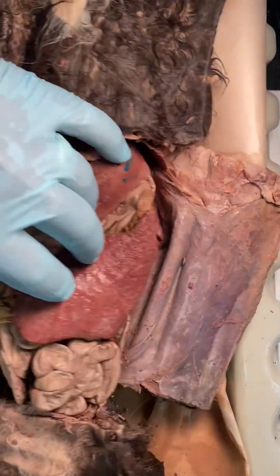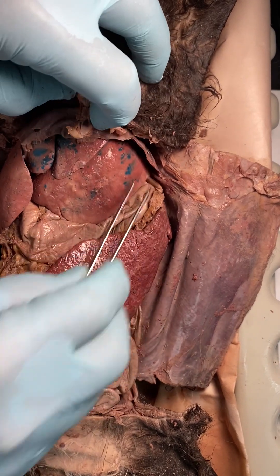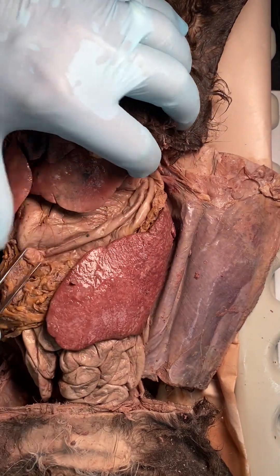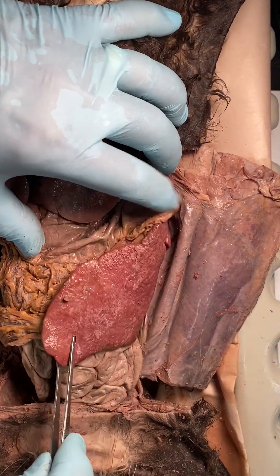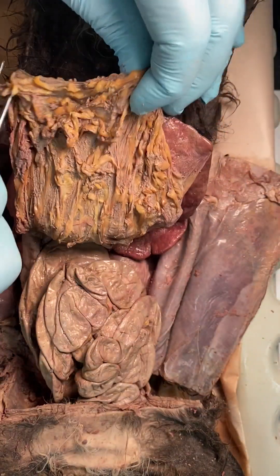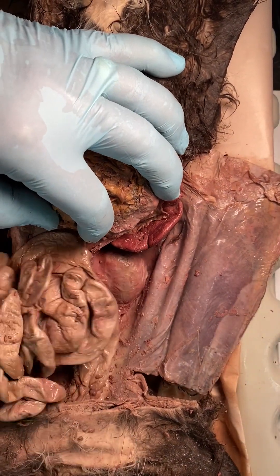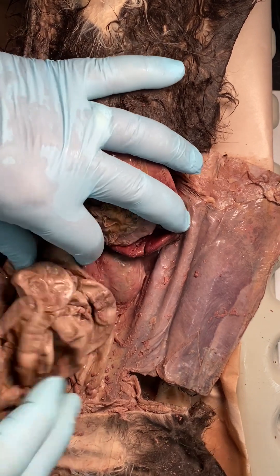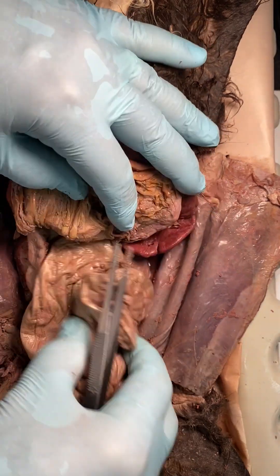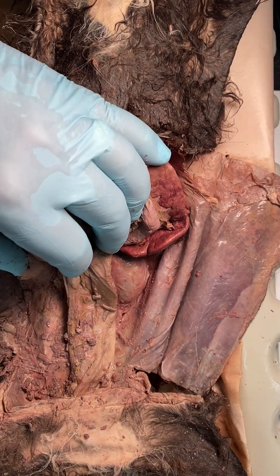Quick recap: there's your diaphragm, liver, gallbladder underneath the liver, the stomach, a huge spleen, and then the greater omentum. We want to reflect all of this out because the lower arteries are deep. Move the spleen, stomach, intestines — both jejunum, ileum — and the colon with the cecum out of the way. We want to look underneath all of that.